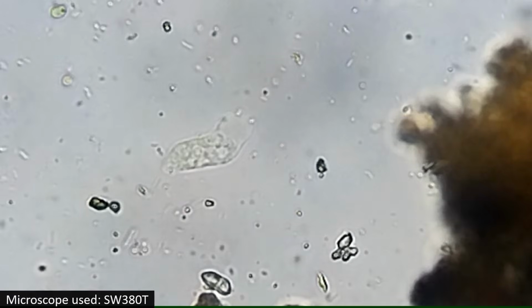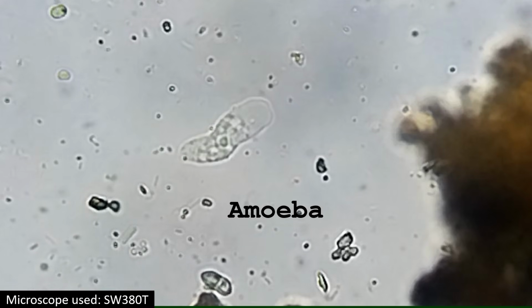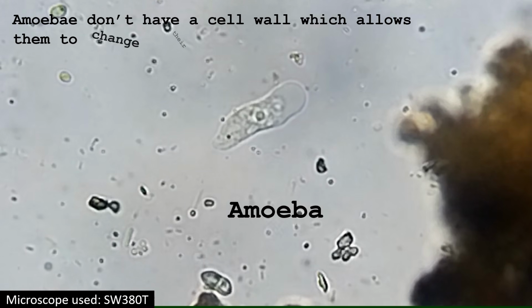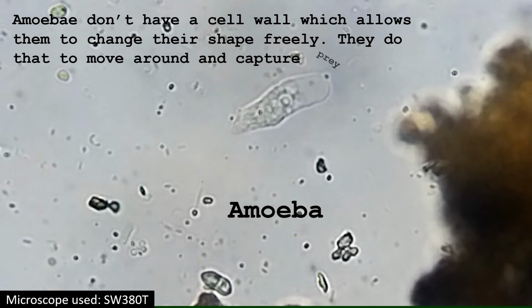Another single-celled organism is the amoeba. Amoebae do not have a cell wall, which allows them to change their shape freely. They do that to move around and capture prey.